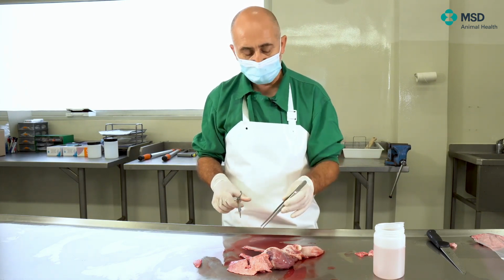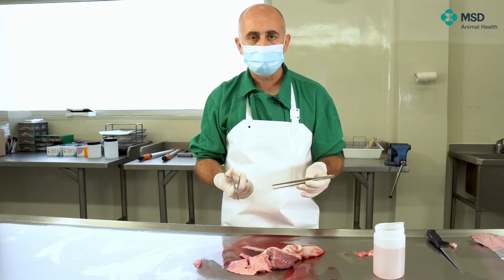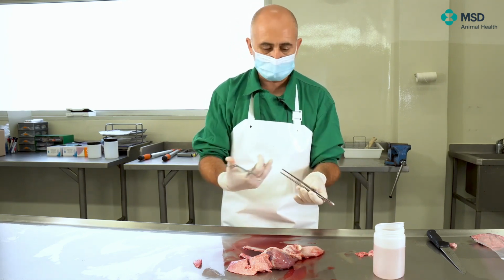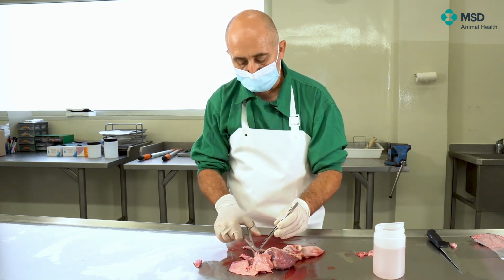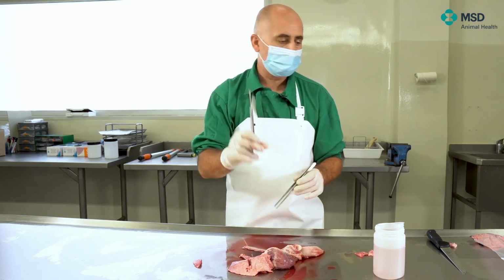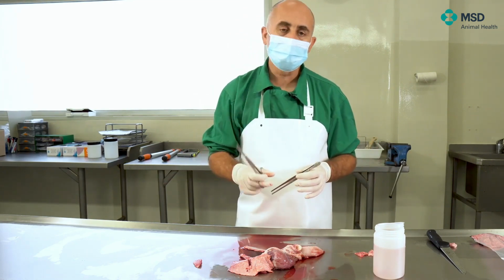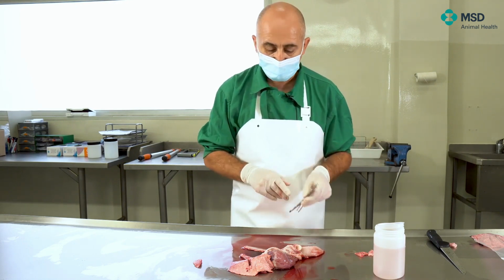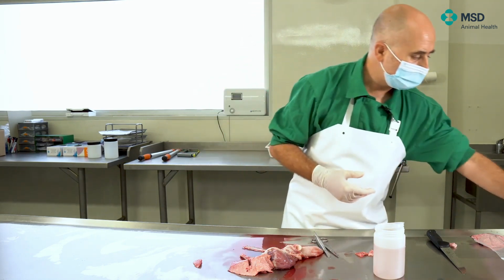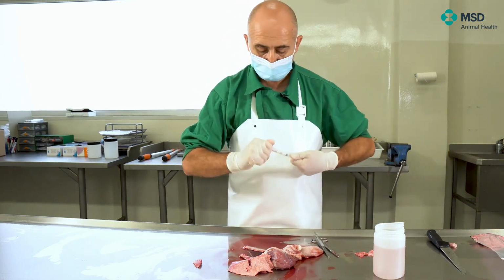It depends on you. Also for PCRs, if you are interested in detecting especially PRRS virus or swine influenza virus, etc., of course, the ideal is the cleanest material as possible, because this is already probably contaminated, and to take really small pieces that you can even put in a small tube or even in a swab. A swab can perfectly work.